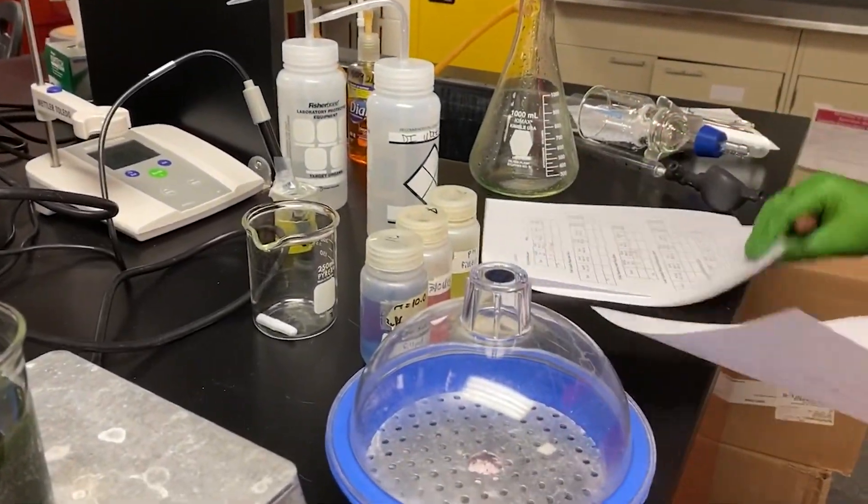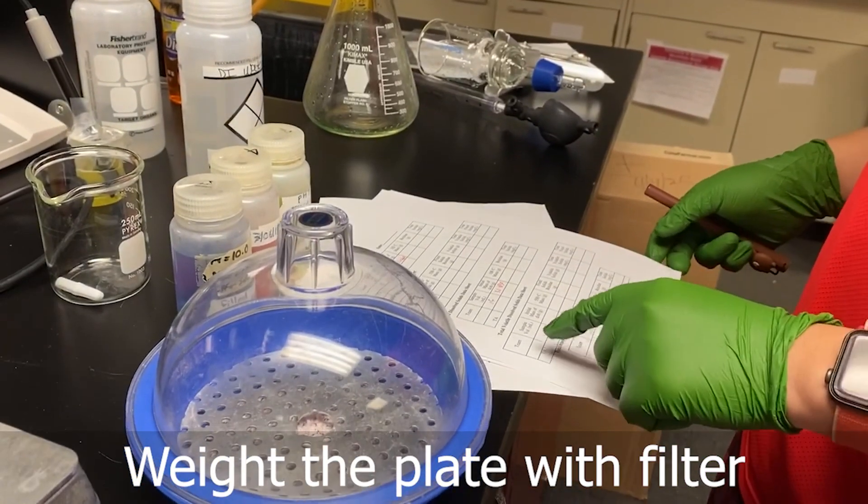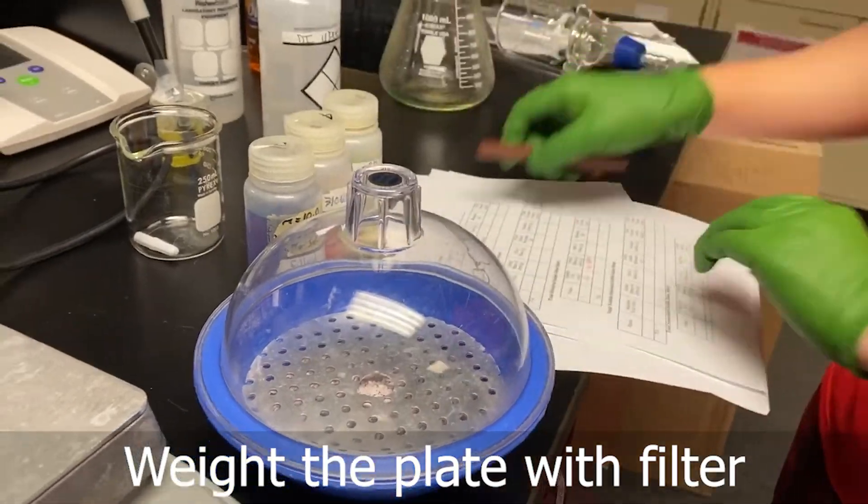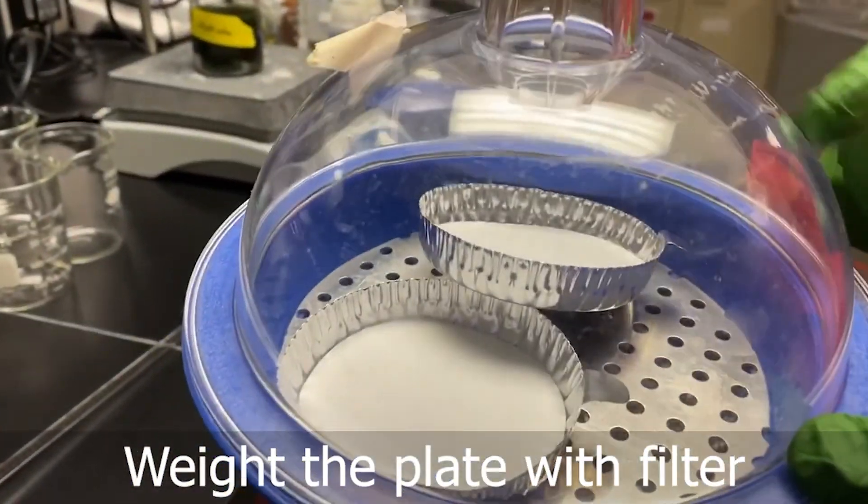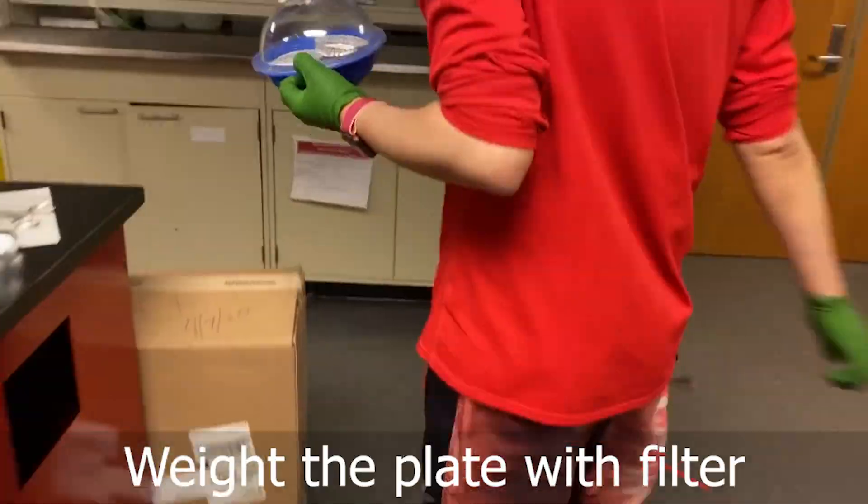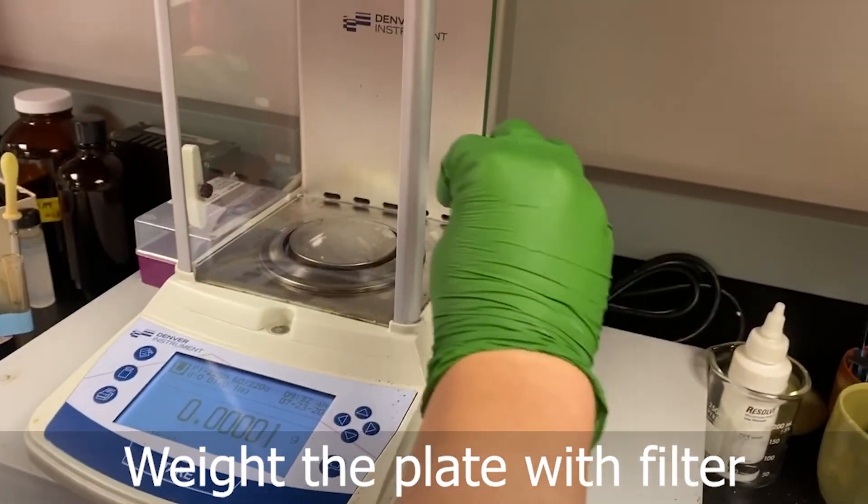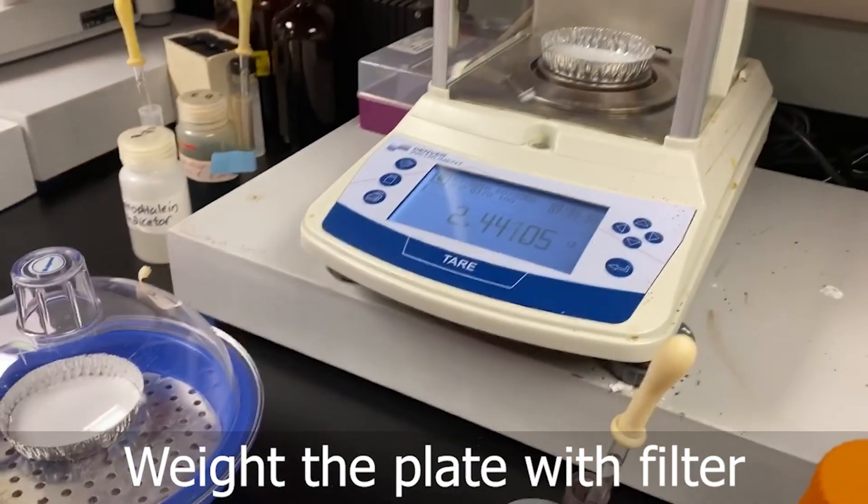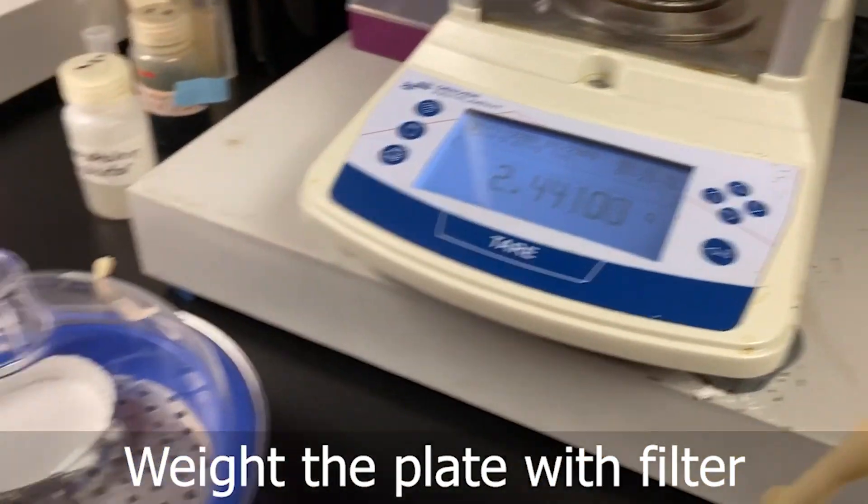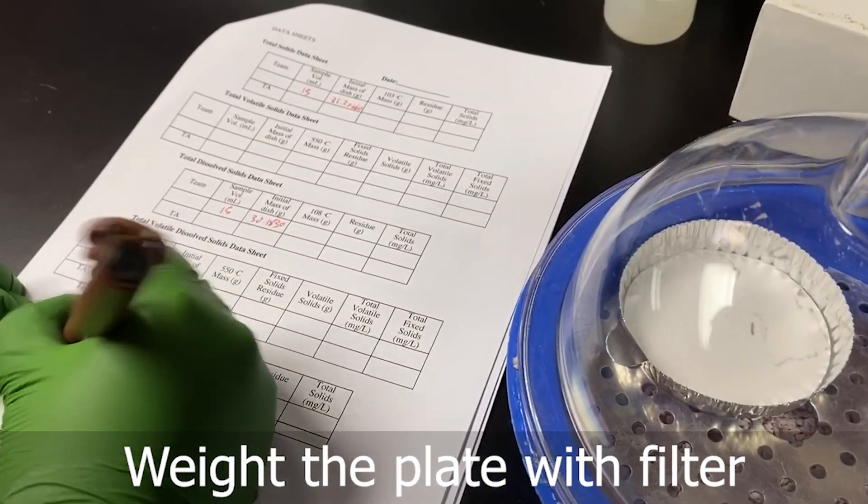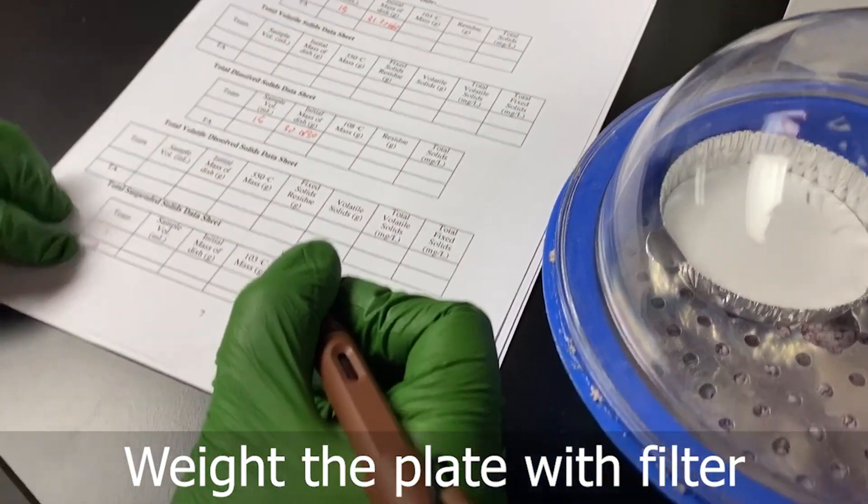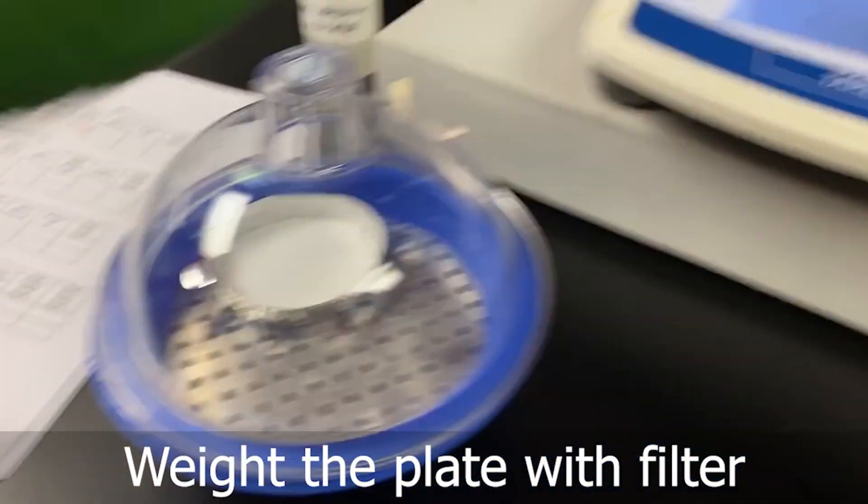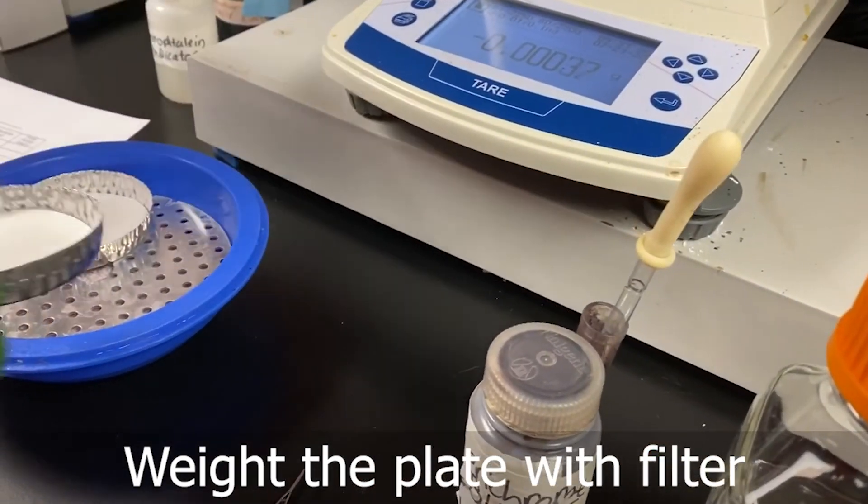And then the next step is to measure the dissolved solids. We need to measure the initial mass of the plates with the filter. And then we put this and take down the mass.